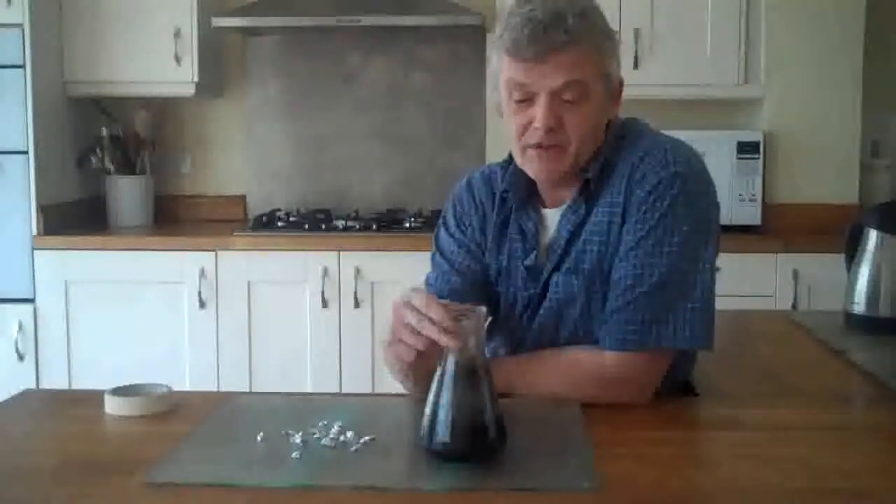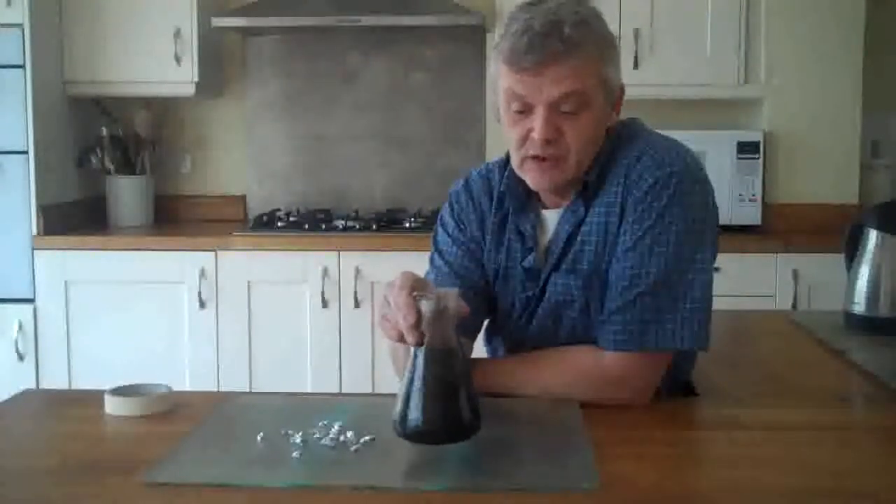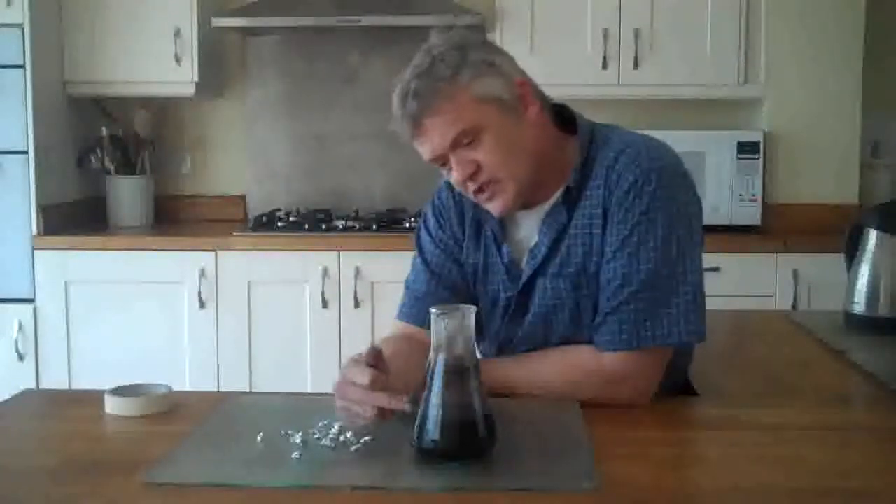Now it is pretty hot — it's hard to hold it. If you're doing it in a beaker, don't overfill it. Give it lots of expansion room because it will expand as it froths. It does help a little bit to stir it — I just swirl it to be honest. And don't add in too much aluminium in one go, you're likely to be sorry. As you can see, it's going a nice deep black colour which is our graphene.